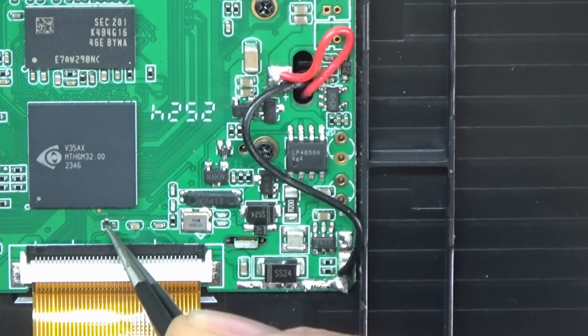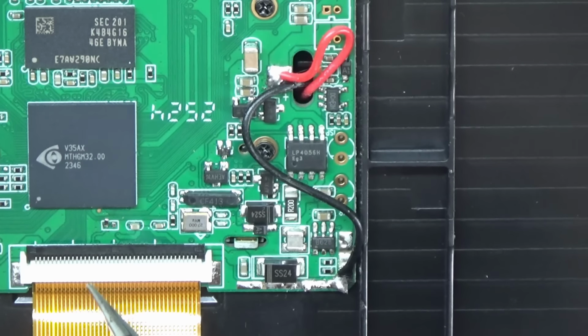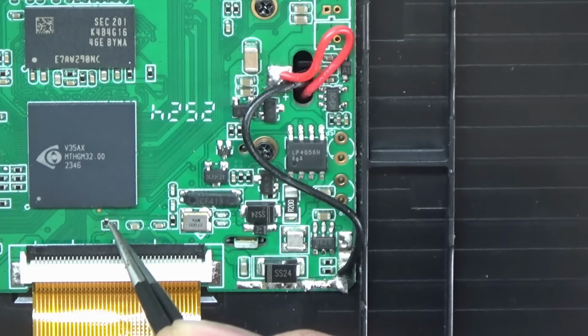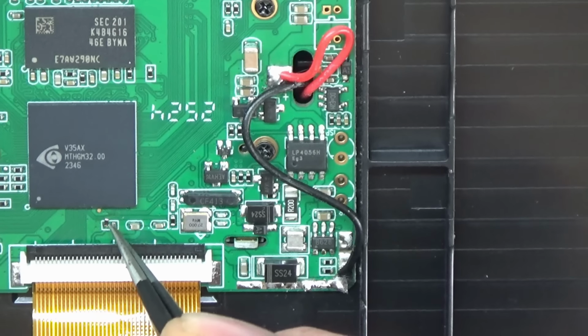So it's actually still attached to the board just by this pad here, but it's no longer connected. I mean, that looks like a ground pad there, so it's obviously grounding out this line here, whatever that one's for, which seems to go down to the board. So perhaps that's why I wasn't getting any sound, because this line here was always grounded. So now we'll put it back together again and we'll see if I get sound recording on it now.